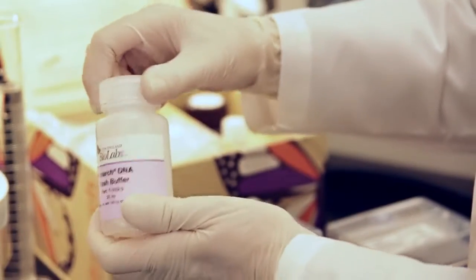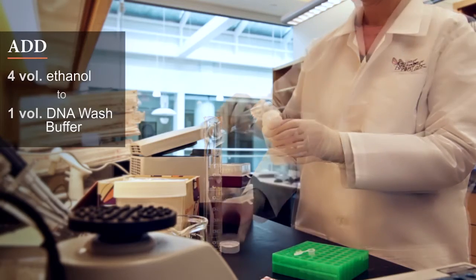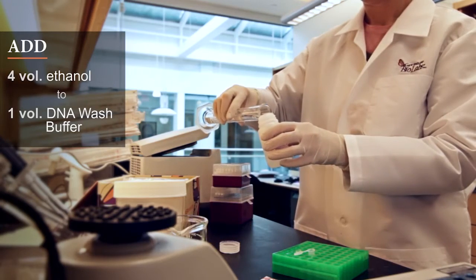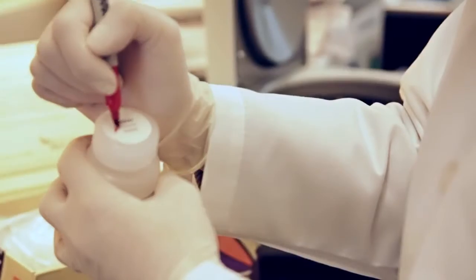Before you get started, add four volumes of ethanol to one volume of DNA wash buffer according to the instructions on the bottle's label.